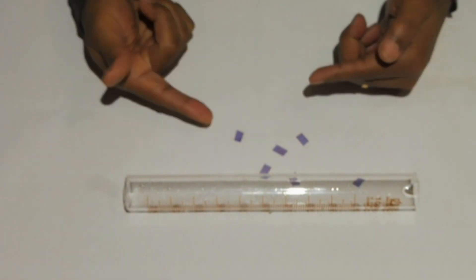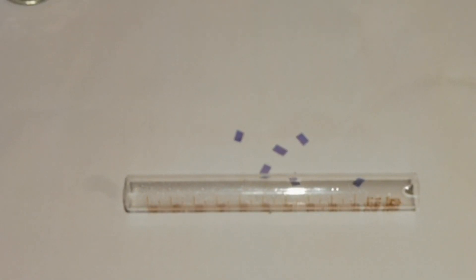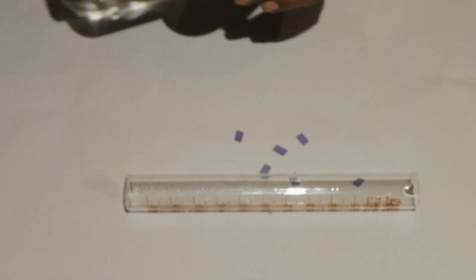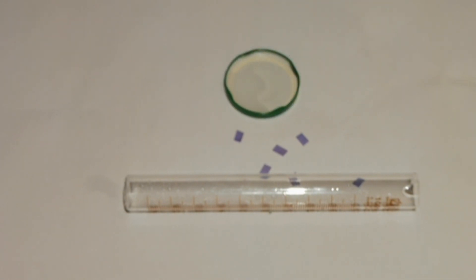We have a challenge to insert the piece of litmus paper into the cylinder so that they stick onto the glass. Water will do the trick. Water will not change the color of litmus paper because it has a neutral pH.